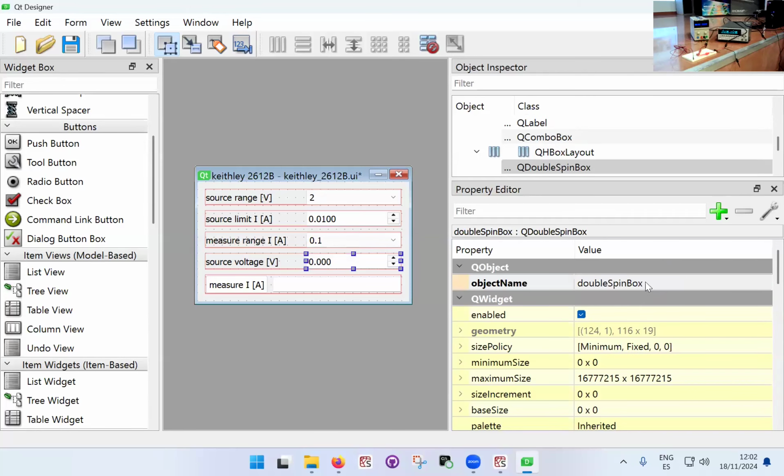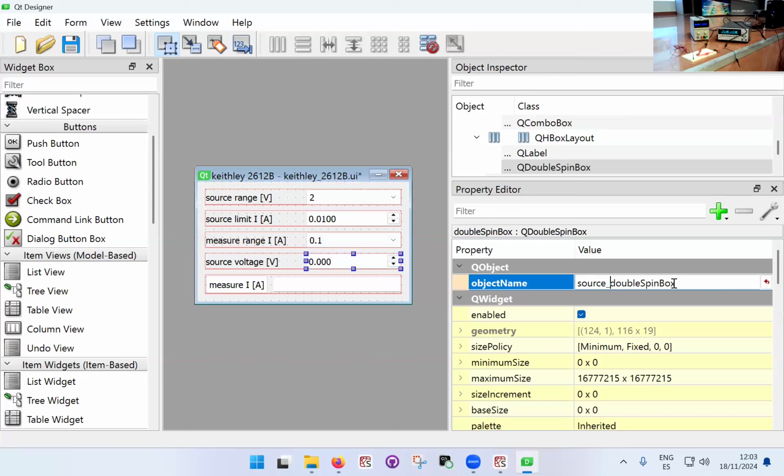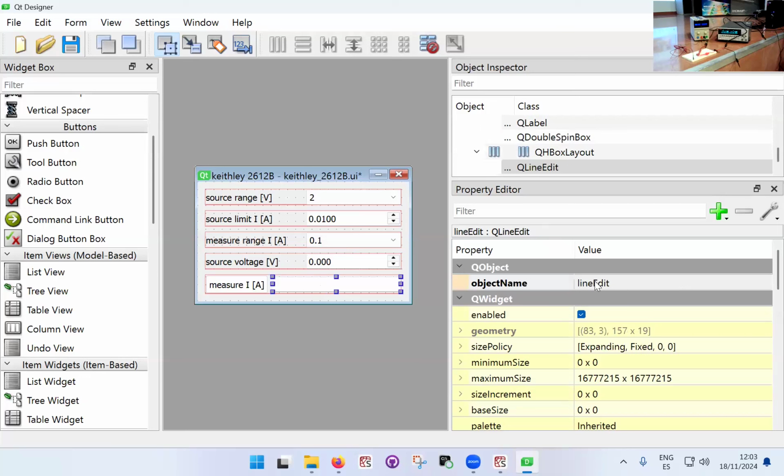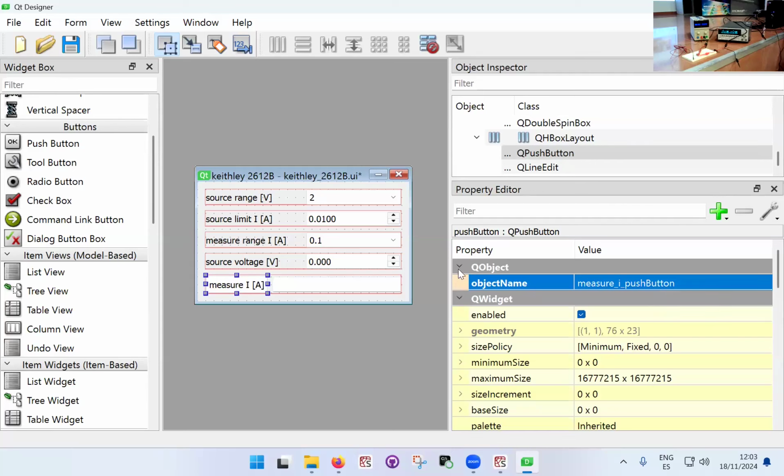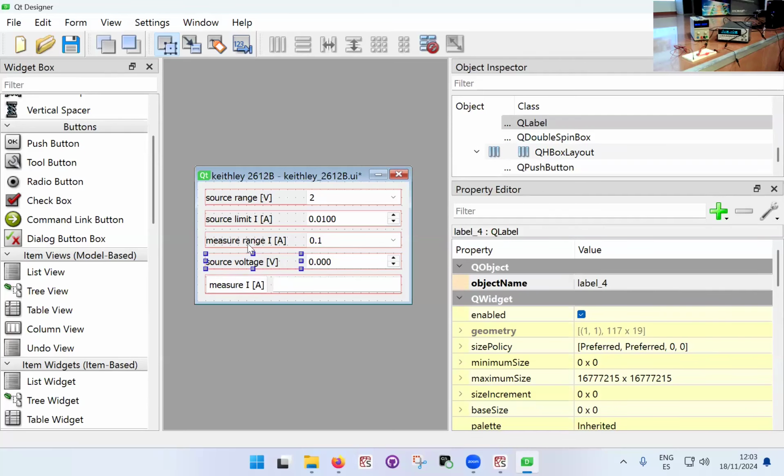And we have the source voltage double spin box, and here we have a line edit, because that's a different one. Measured, I'm going to put it measured I line edit, and this is the button as well. Measure I push button.